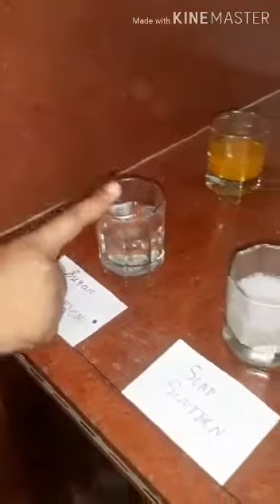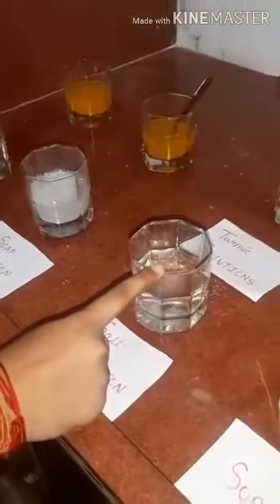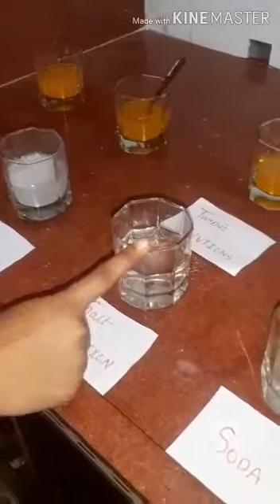Here you can see different types of solutions. First is sugar solution, second is soap solution, third is salt solution, and fourth is soda.